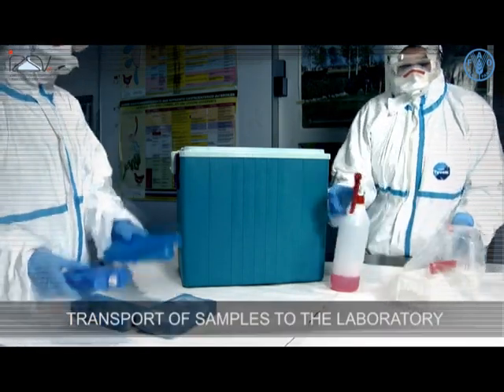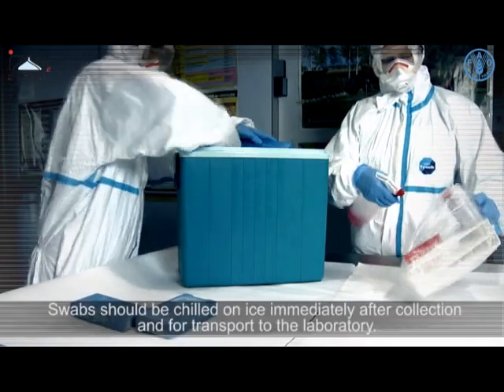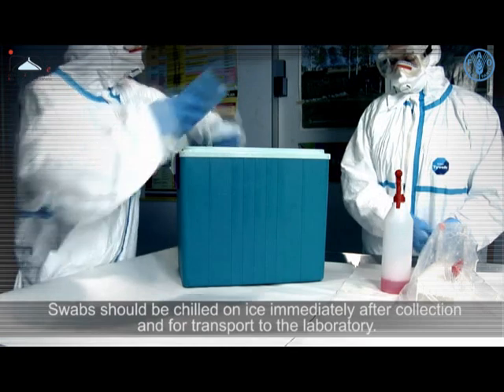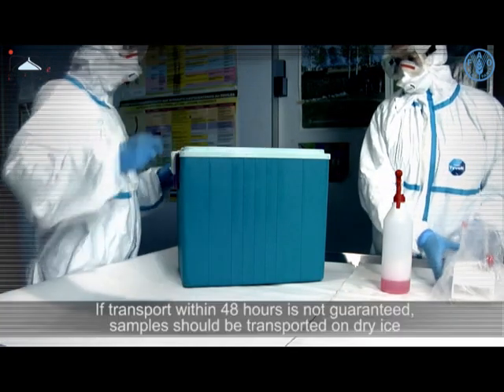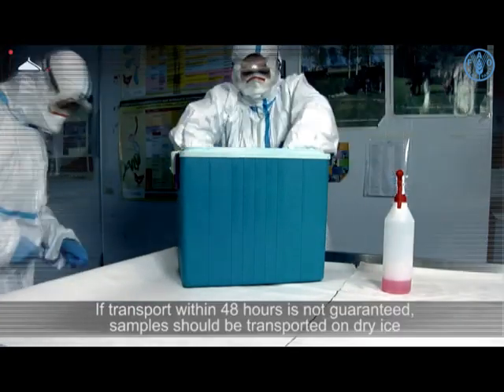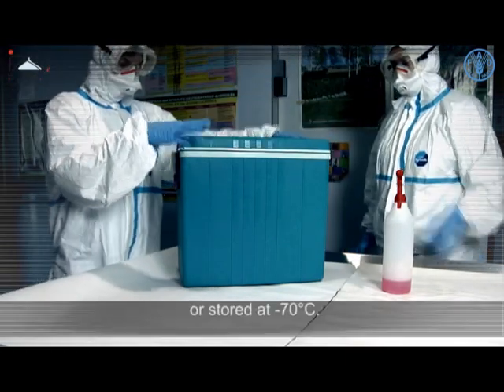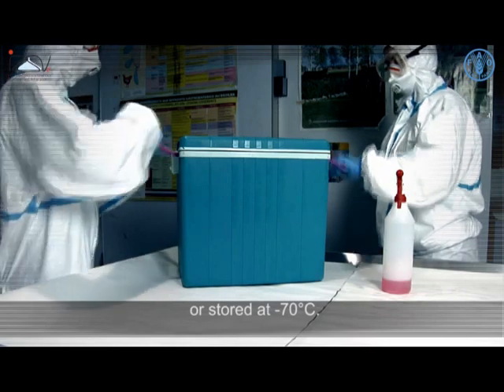Transport of samples to the laboratory: swabs should be chilled on ice immediately after collection and for transport to the laboratory. If transport within 48 hours is not guaranteed, samples should be transported on dry ice or stored at minus 70 degrees Celsius.